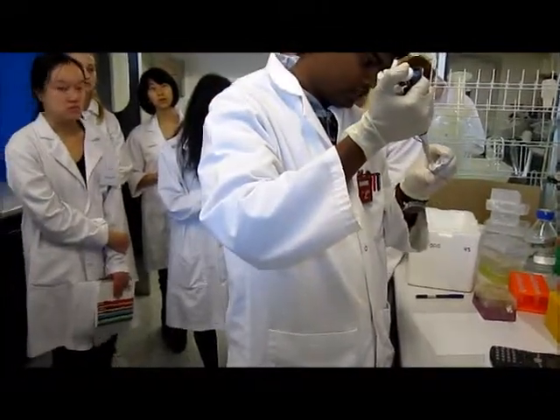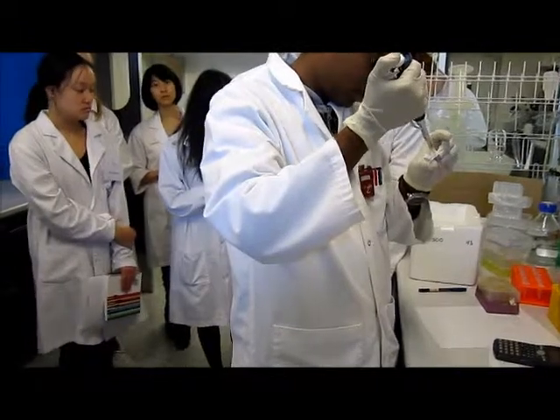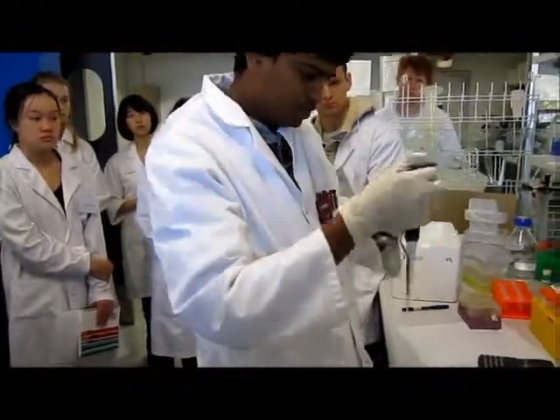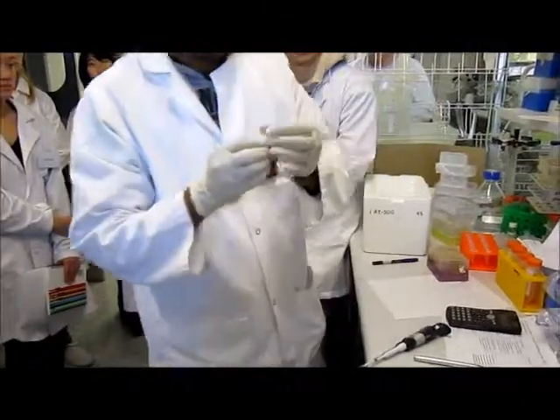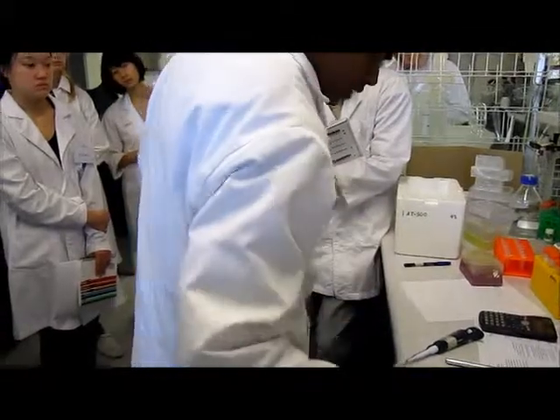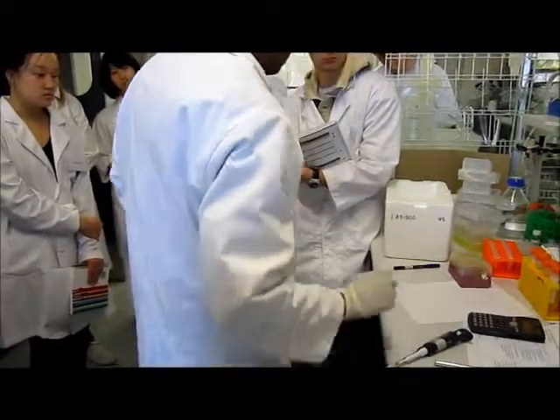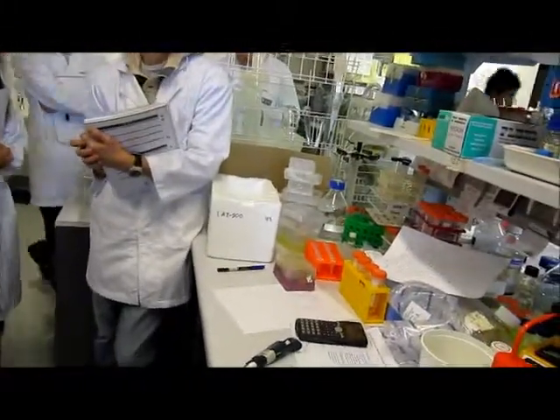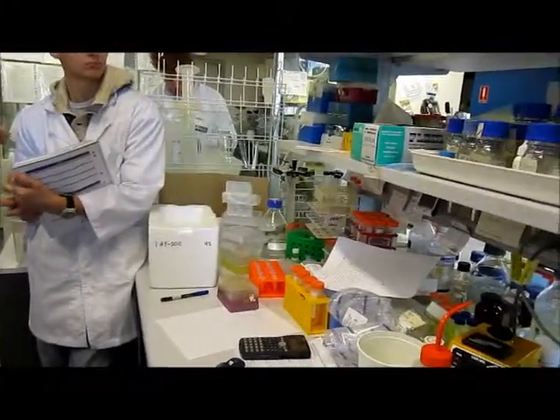I need to give it a spin because I cannot take it out from here. Which one is that, PMK mag? Okay.